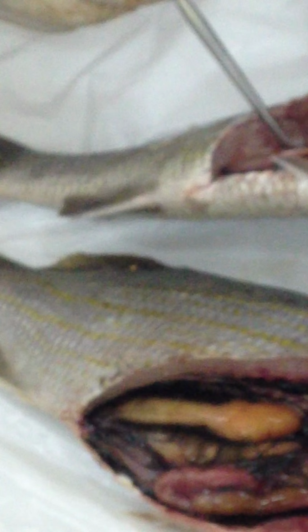Then you see this swim bladder. I think in this one it is collapsed completely. Let's see if we can see this one. Even this one is collapsed. So let's see if we can put something in there and show you the cavity of that. So that's the swim bladder there.